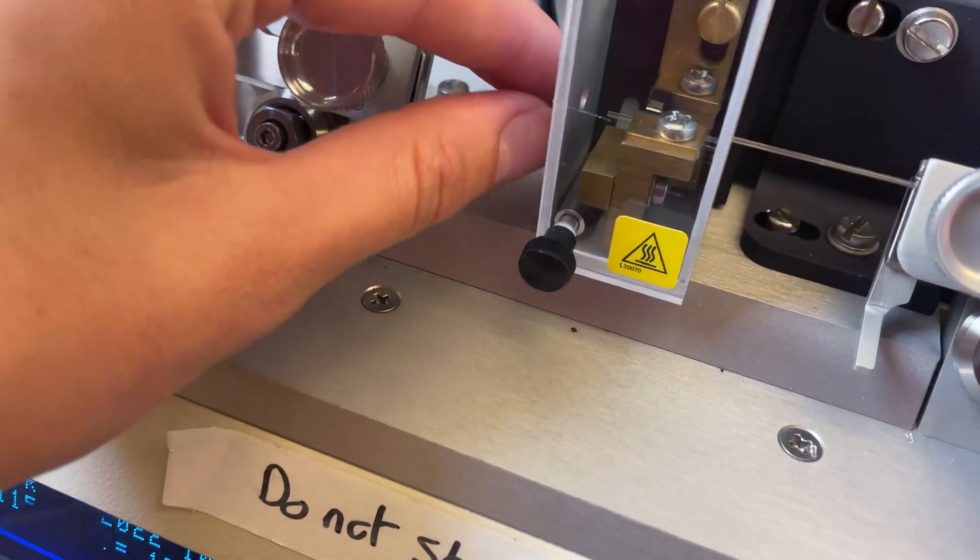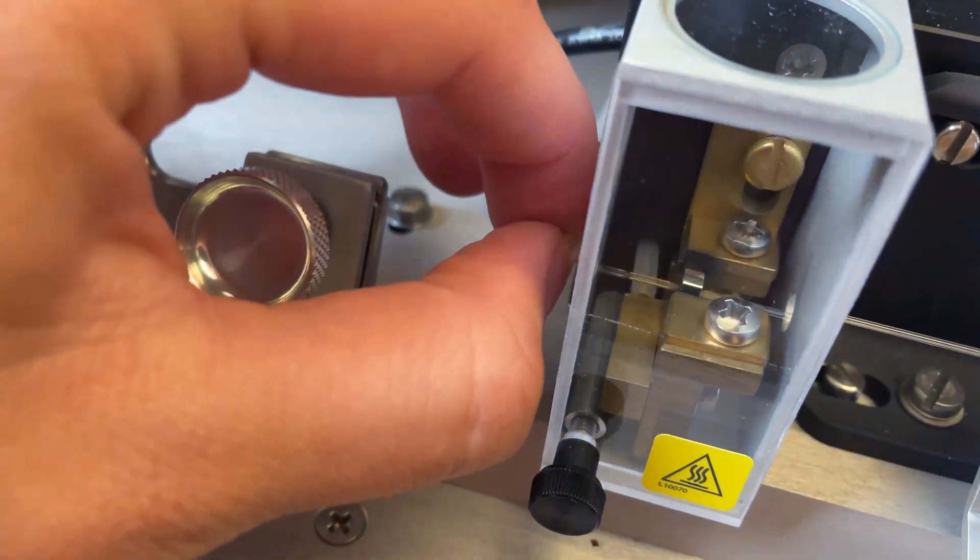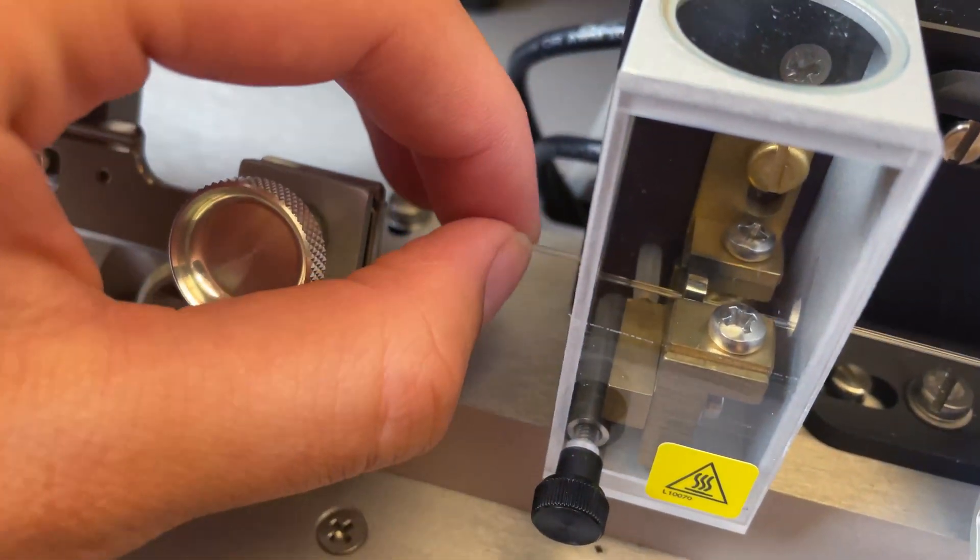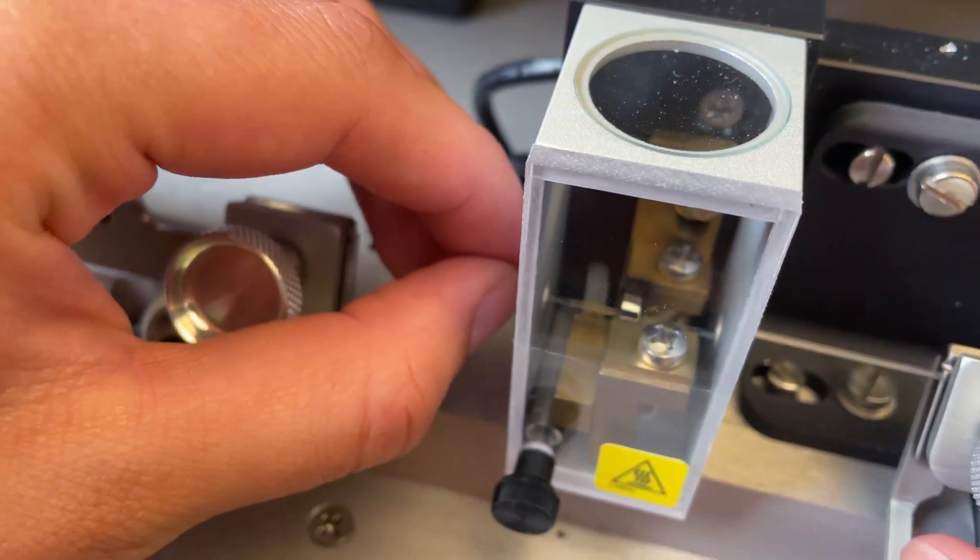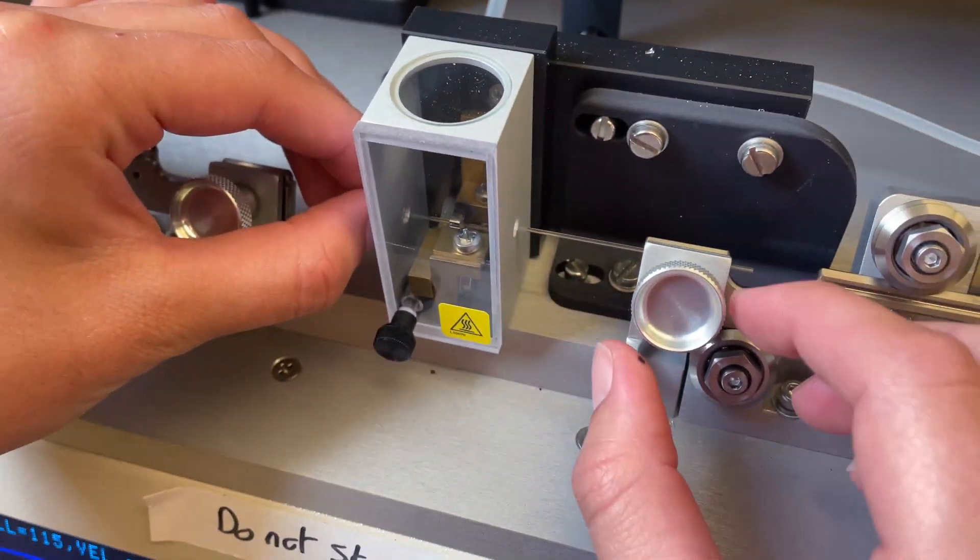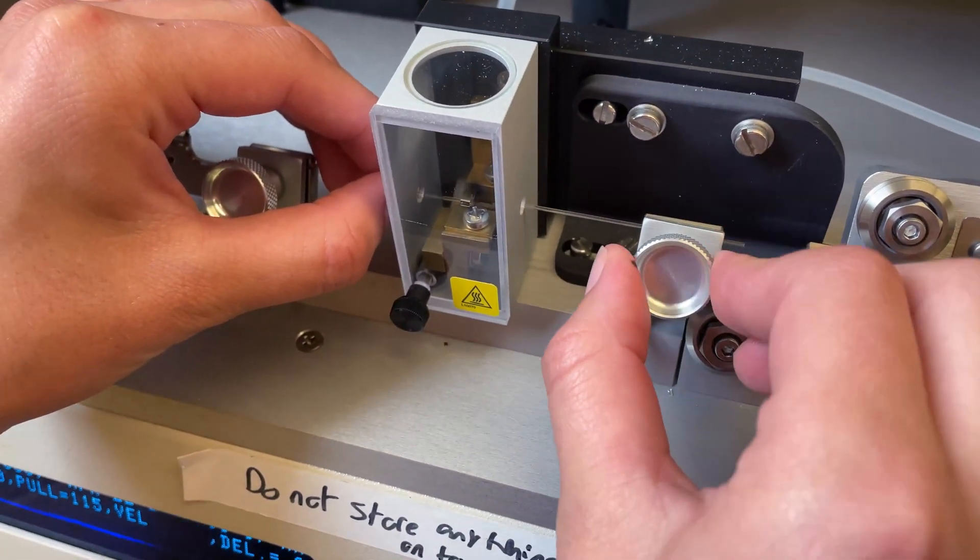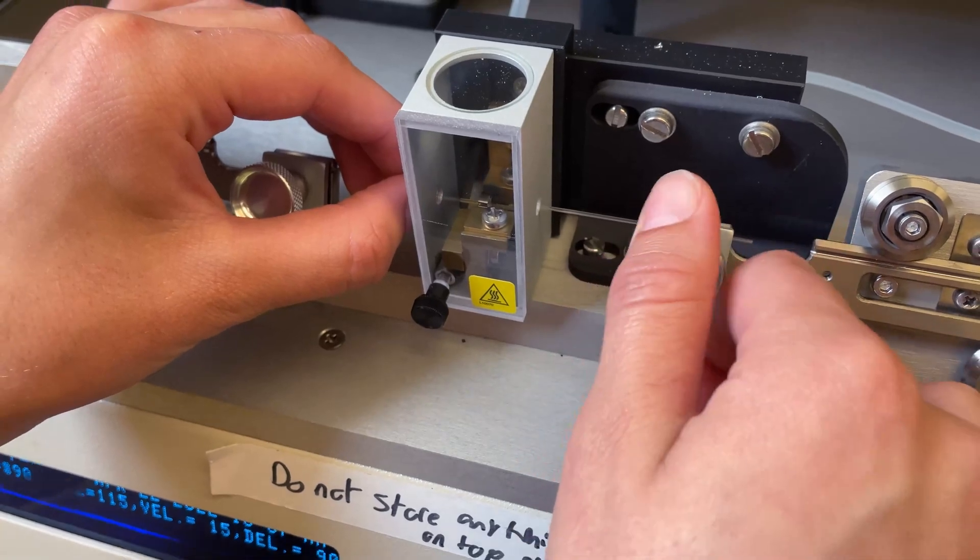So we want to go through that metal piece and we are going to try to get it even on these clamps. So I usually go about a quarter of an inch out and then screw it on and tighten it up.